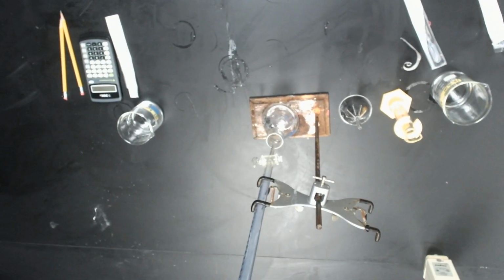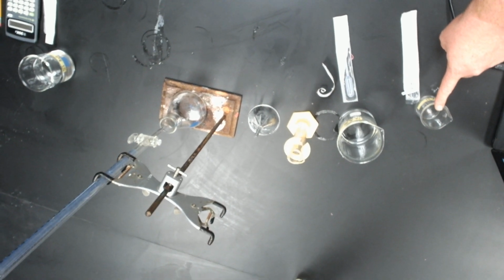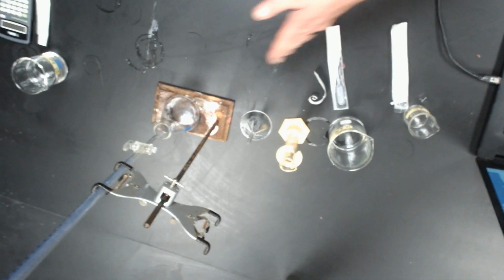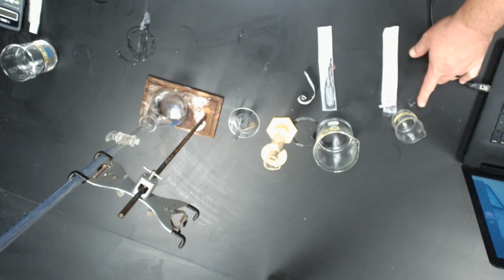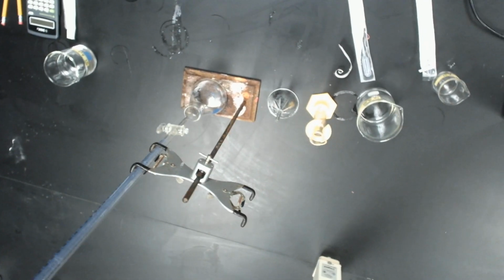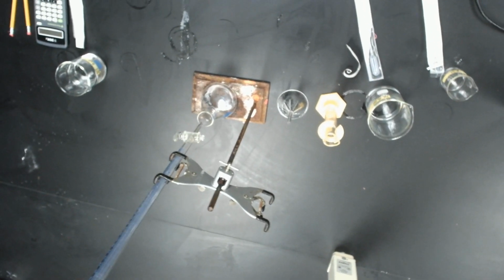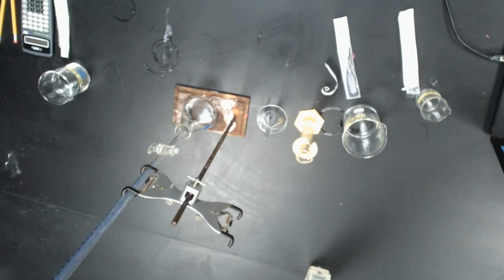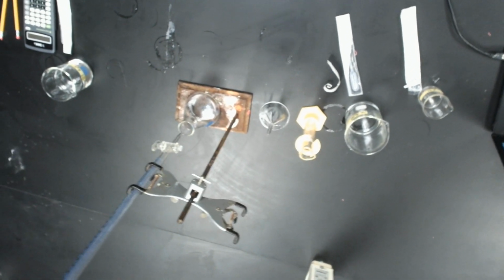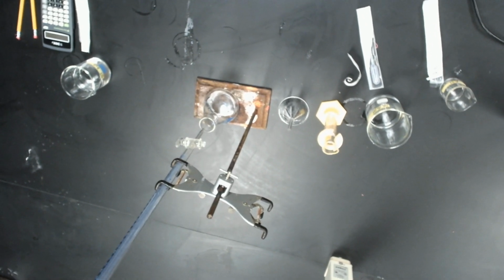So what you're going to do is you're going to be tasked with identifying the ID of the acid, or the concentration of the acid, by doing a titration. So the acid, you're going to use 30 milliliters of your acid, goes in your flask. You'll fill up the burette with our NaOH. You will need to get the phenolphthalein, which will be in the center of the lab station. So grab your phenolphthalein, add 2 drops into our flask there, and then do your titration.